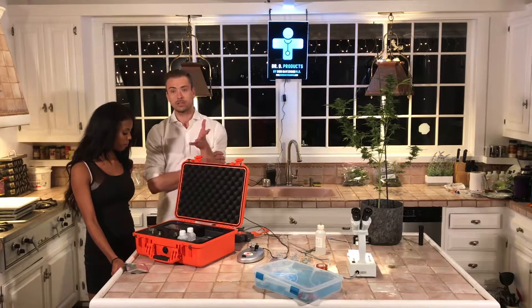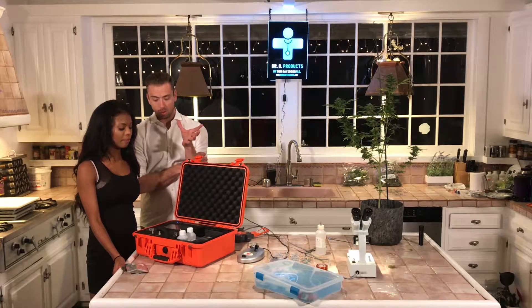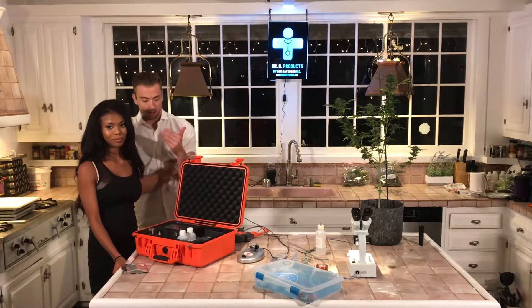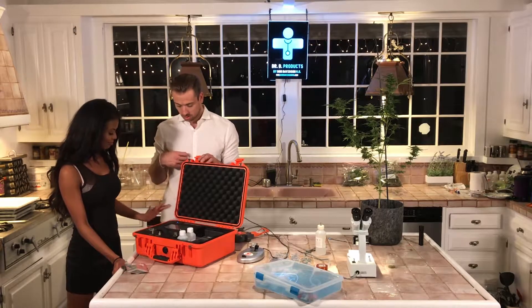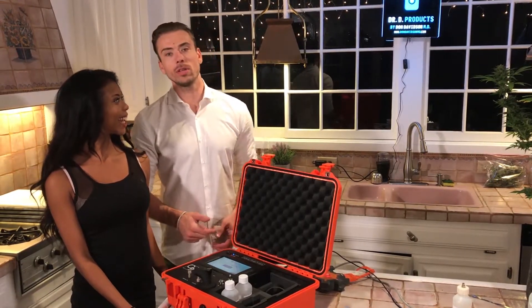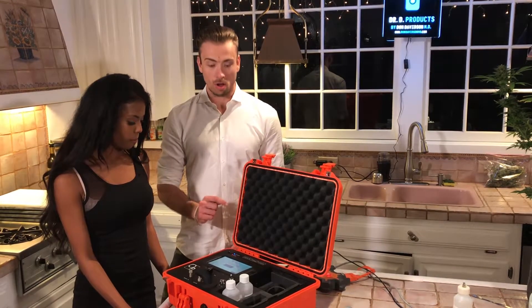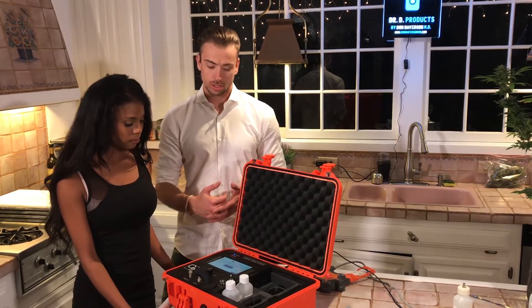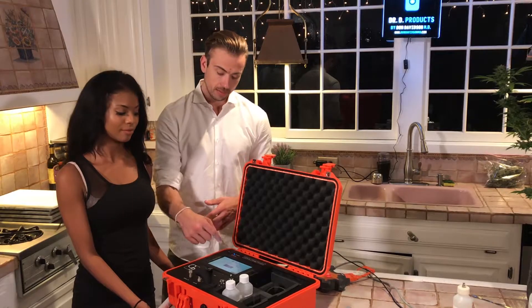To do this, I'm going to walk you guys through the steps of using the Light Lab, and I want to show you how someone doing this for the first time is able to follow along without too much trouble and actually have fun with the process. So press the on button. Our lovely assistant Nia is going to show you all how to test this flower. She already turned it on and the machine will start up — it does an electronics and detector check, checks Bluetooth, things like that, to make sure all the technology is working. And now it presents her with a message.